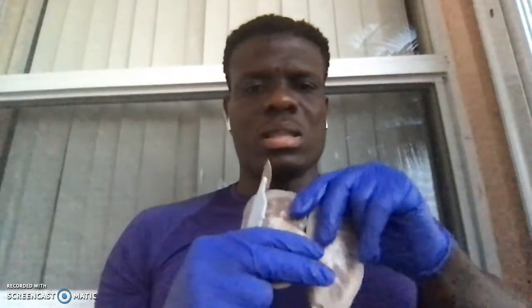So today we're going to be talking about the different anatomy of the kidney, for this chapter being the urinary system. On Blackboard, it had displayed that we're supposed to do a dissection on the sheep's kidney, but in fact, we actually received a pig's kidney. So this is really a dissection of a pig's kidney, which is essentially the same thing. So we're just going to be talking about the different anatomy. As I'm talking, hopefully you'll be able to see.